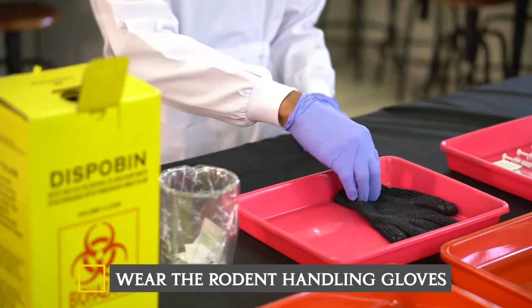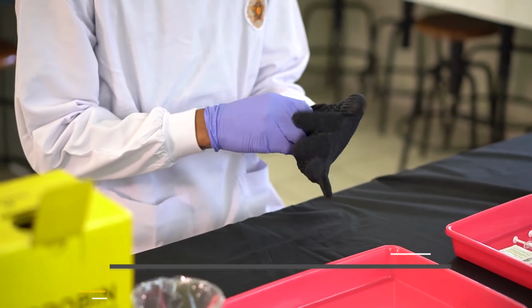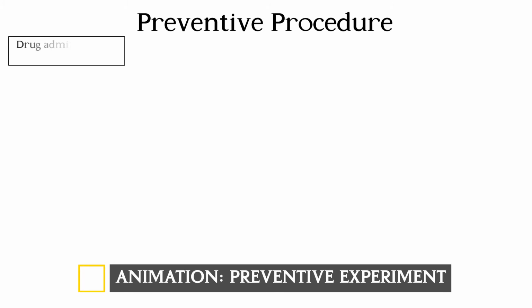Wear the rodent handling gloves before holding the mouse. The procedures of the preventive experiment are shown in this diagram.